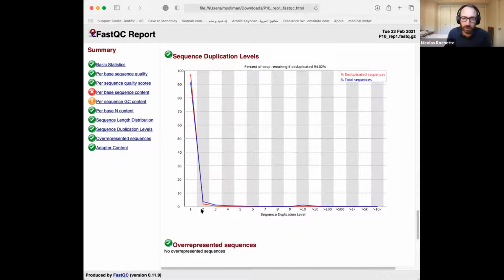Duplication: these are the sequences that are seen many times. Usually for RNA-seq, we're going to see a peak at 10 or more, or 50 or more, or 100 or more. So we're actually going to see an excess of sequences that are present many times. That's just because in a transcriptome, some genes are more highly expressed than others. Let's say actin is going to have a lot of reads on it, so the sequences from actin are going to be present many times.